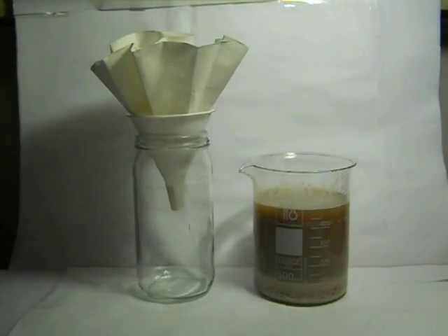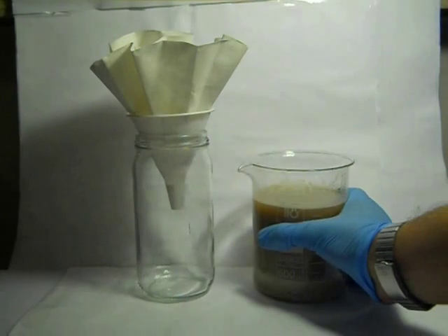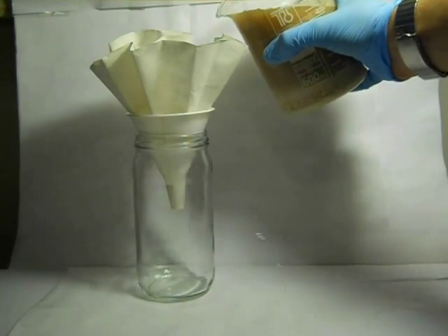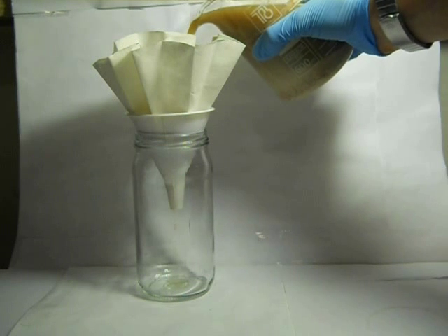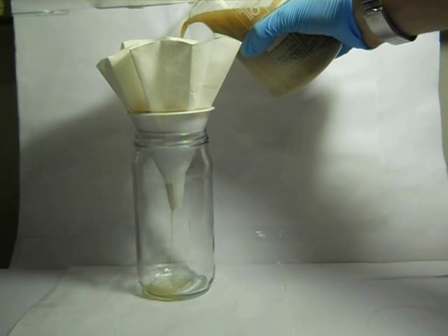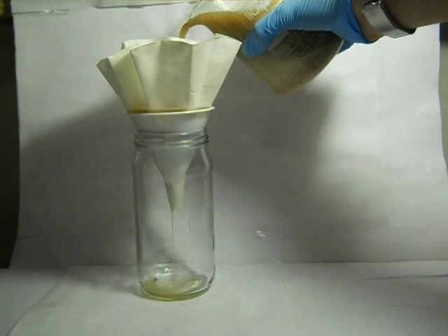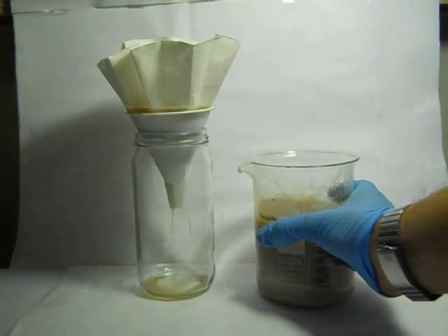About the filtration, I suggest you use a vacuum filtration apparatus. If you haven't got it, the filtration will be long, lasting between 2 and 3 days. But you don't need to stay there for all this time, and on the contrary, there are many things to do in the meantime.